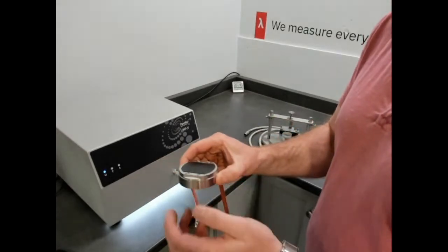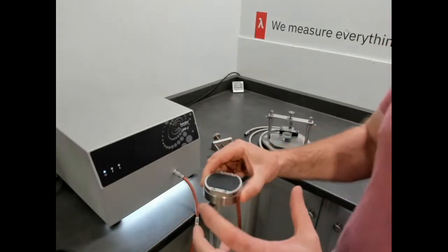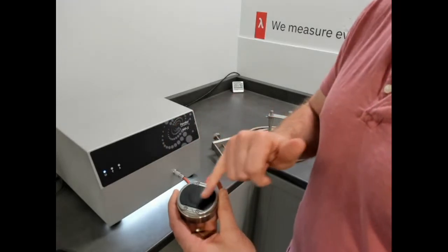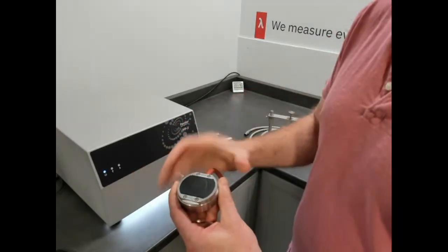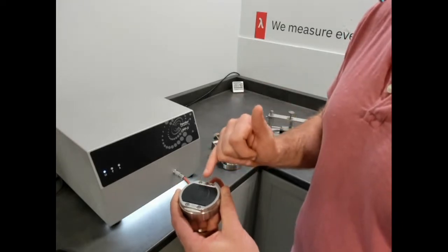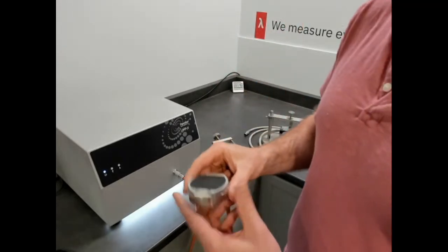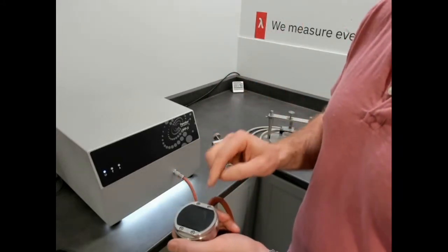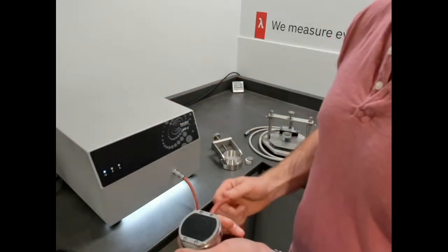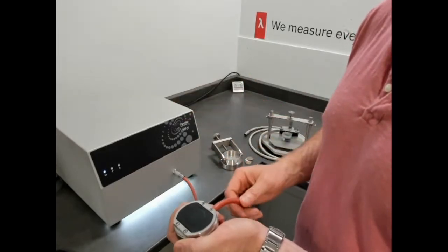So with this one, the construction is very simple. It's elegantly put together, but if you were to see, and we have another demonstration where we do break this apart and show what the construction of this is. So underneath the double spiral, which is stretched over a piece of foam, that foam underneath is a known material. So there's no calibration, no contact agent. Additionally, what this allows you to do is vary the test time and power. So because you can vary the test time and power, you're following the ideal theory for transient plane source, and you can make very good measurements across a wide range of conductivities.